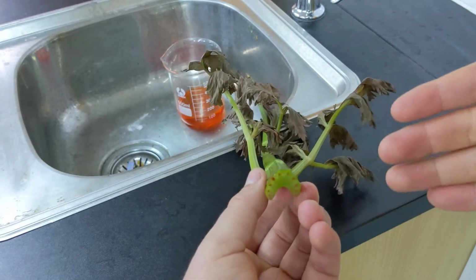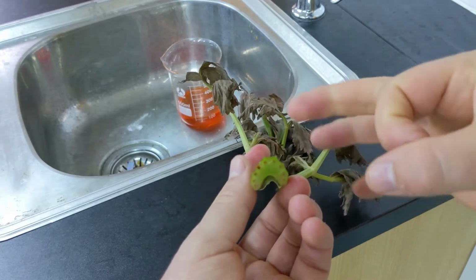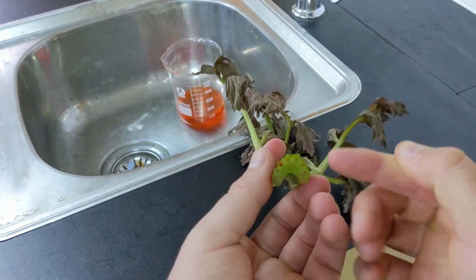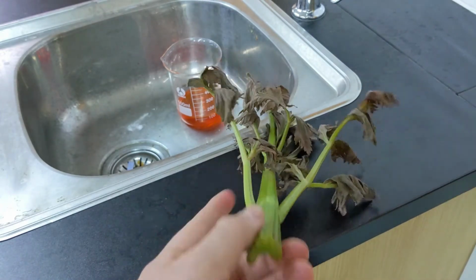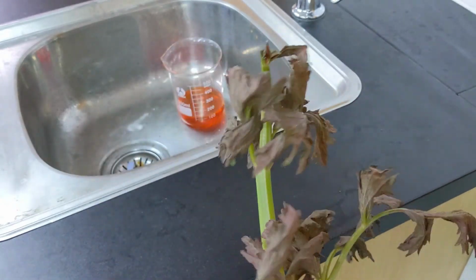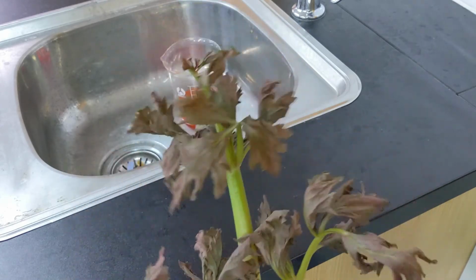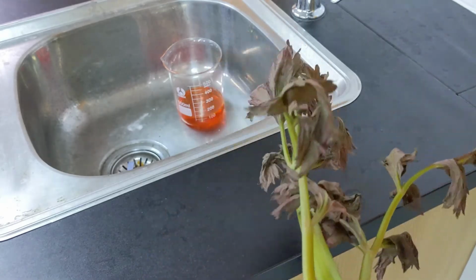But now, remember on our roots prac, when we looked at the cross section of our roots, we could see that there were vascular bundles. And I said in there, we're going to do a prac where we're going to see which is which. So we're going to identify it now using this, and you can see how all of the water has actually made it to the leaves, the site where photosynthesis is occurring, needing that water. And that's actually quite a neat little experiment to show that. And we're going to just have a look on the microscope now.